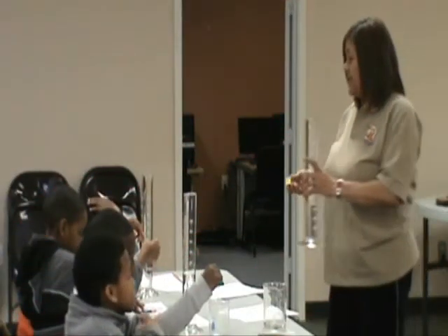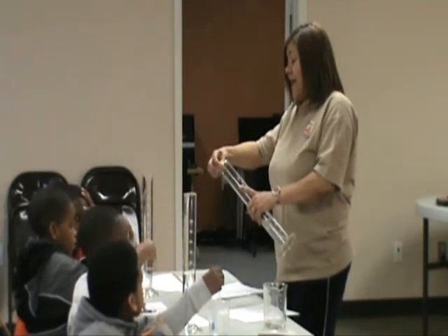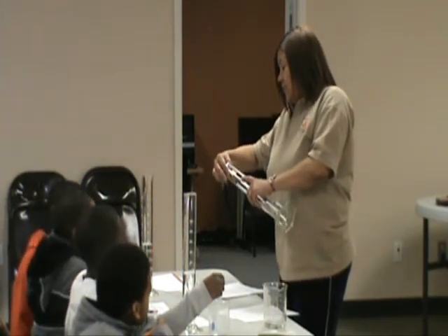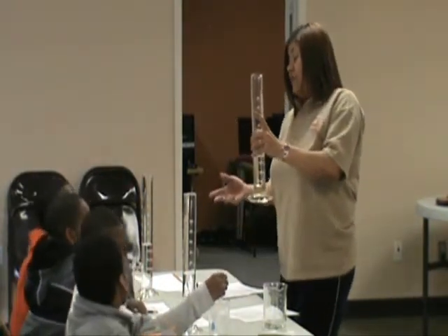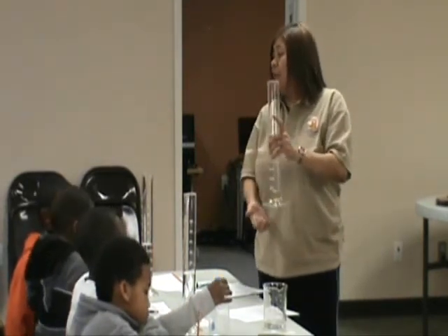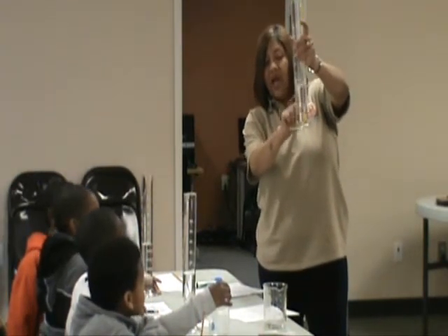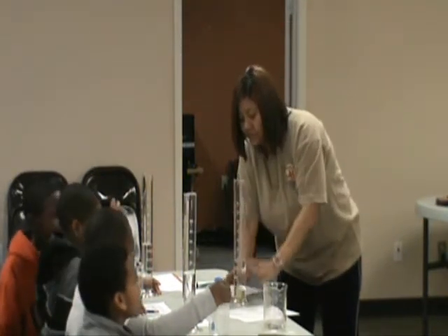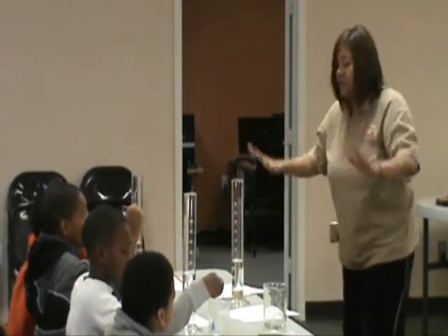When you get ready to do this, you'll stand up again. Not yet, just let me show you. You will take your mass, watch me, and you will hold it because you're very patient, and you will let it sit right there and slowly it goes in. If it gets away from you, it's okay, just go as slow as you can. Don't throw it down in there because it will break the bottom. Once it goes down in there, look at that air bubble. Get those bubbles off of it. Get your technique. Let it settle down. Get those air bubbles out. Hold on, I haven't released it yet.